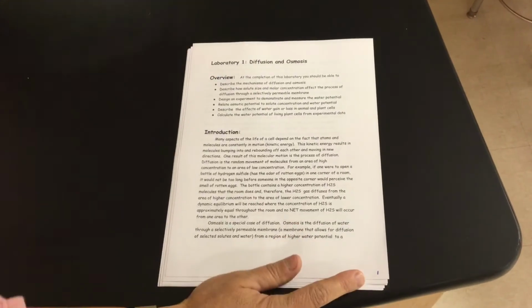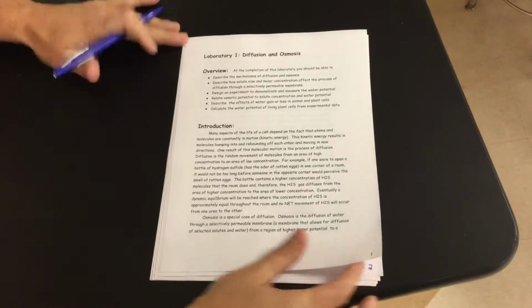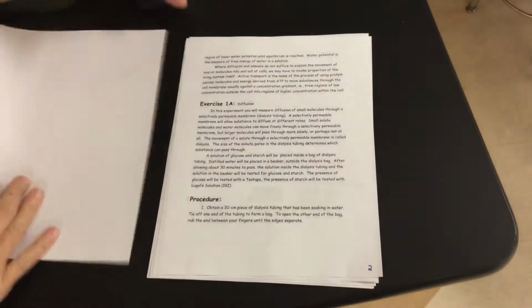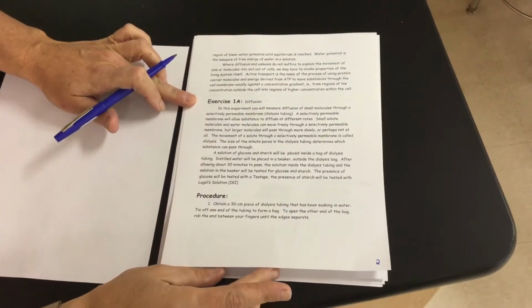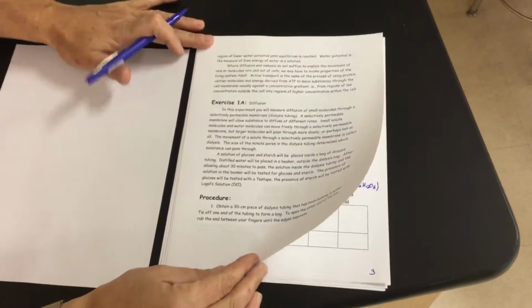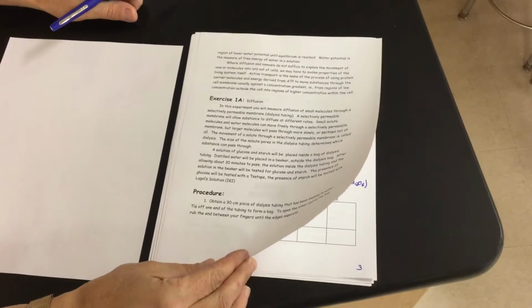I've numbered my pages. You guys have them on a Google Doc, so they'll pretty much go right in order, just so you guys know where we are. You should have already been able to read through the introductions. That covers page 1 and 2. On page 2, you're going to see exercise A. It talks a little bit about the procedure, which I'm going to run through for you guys, and then we'll come back in that second video tomorrow and look at our results on them.